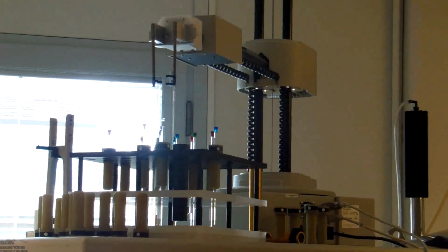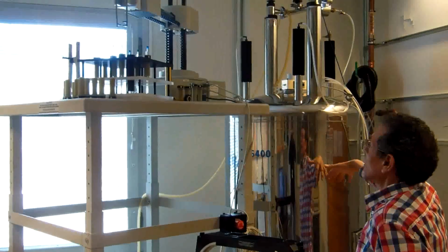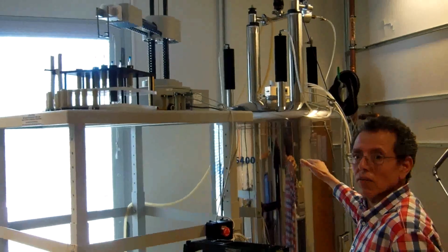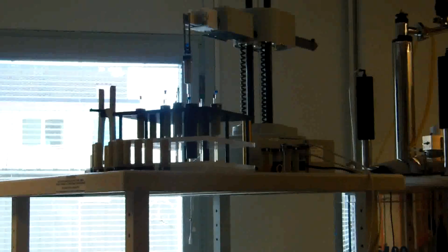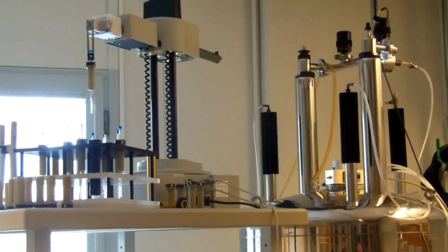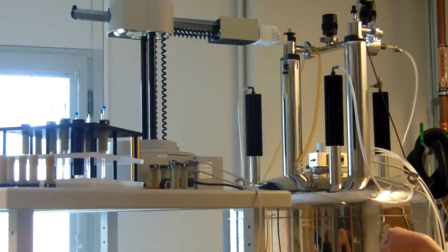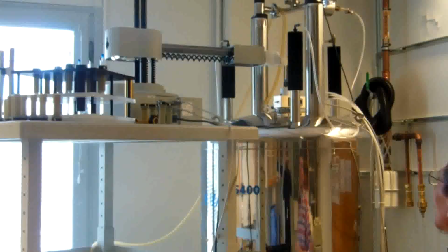Of course, as you know, this is the machine, and it is 400 megahertz, and it contains a magnet inside. That's why this machine is so expensive. It is usually several million for 400. Now we take our sample from number 2, this way, to put it inside, and then it will be exposed to the magnetic field, and it will start to scan. Bye-bye to the sample.